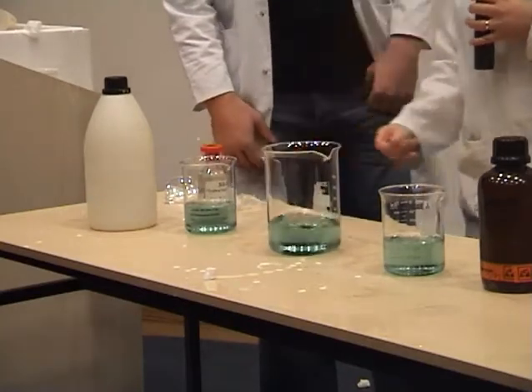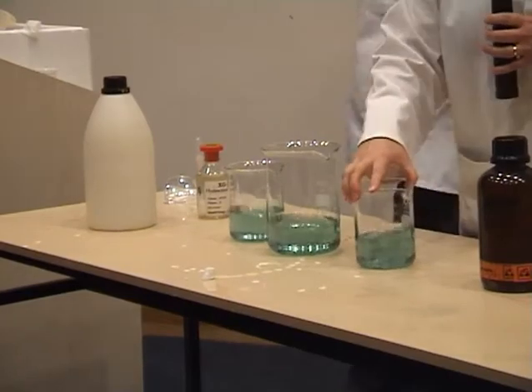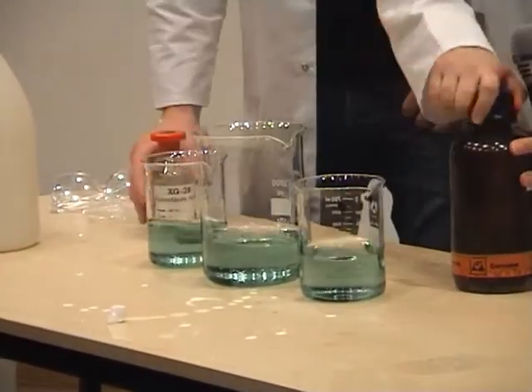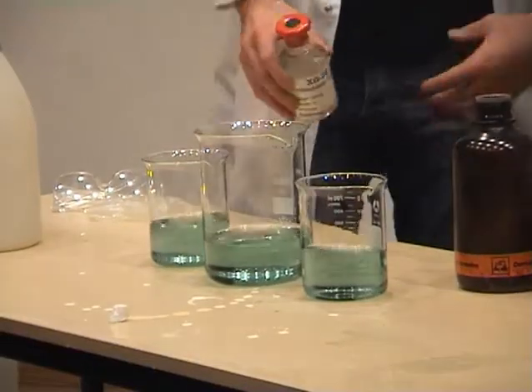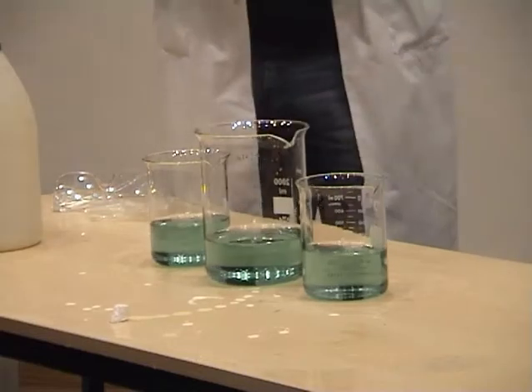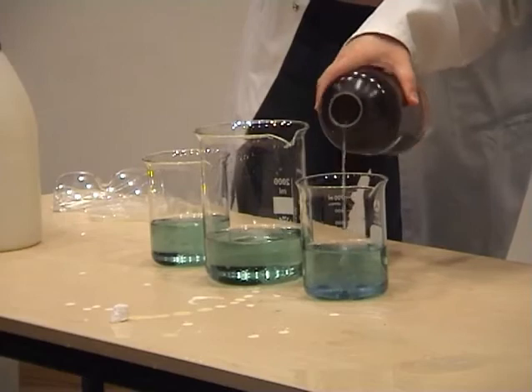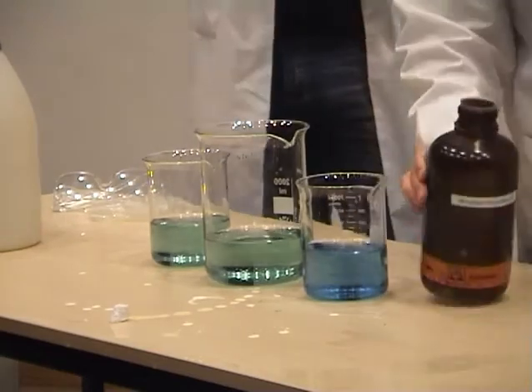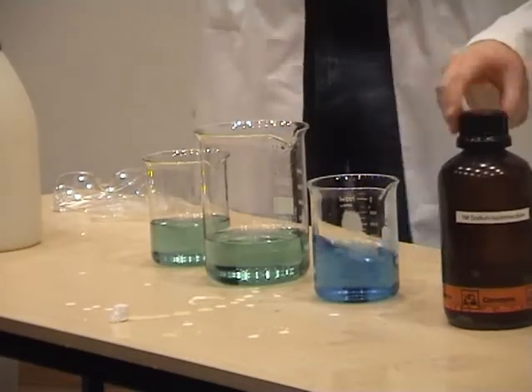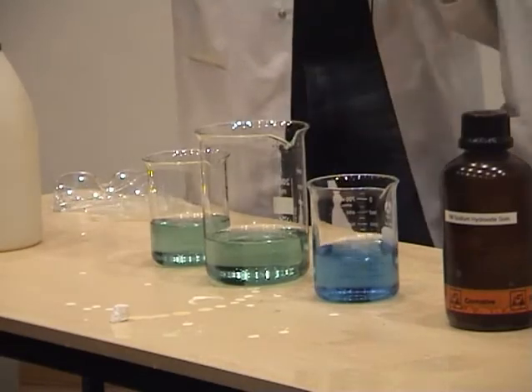Okay? Daniel, just line them up here so that folks can see our colours. Okay. I'm going to add a small drop of sodium hydroxide. It's a base. Just going to pour a small drop in here, see what happens to the colour. There you go. Wow! Okay, see what you can do in there.